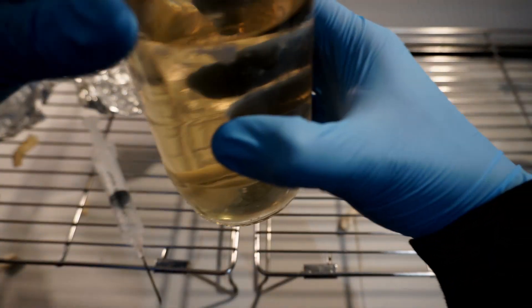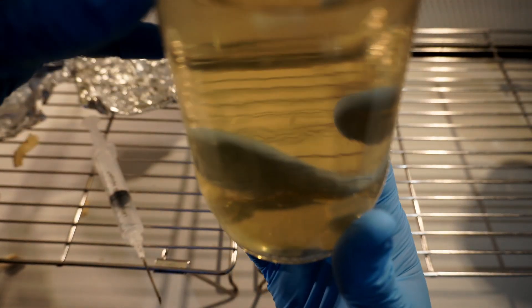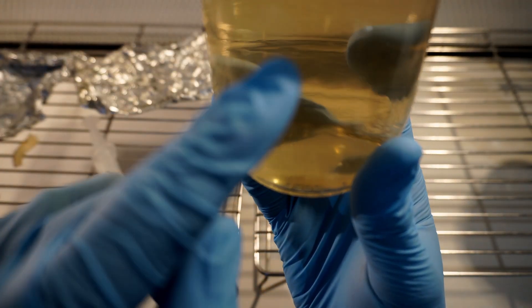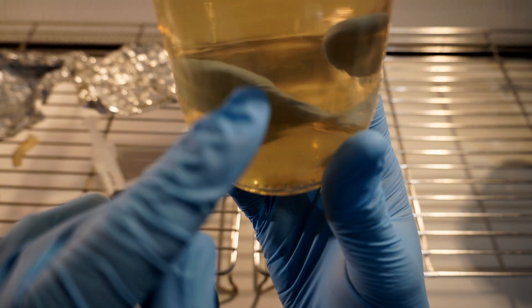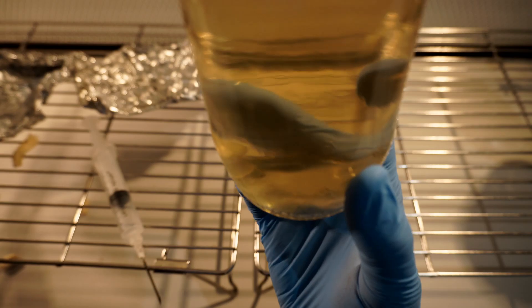There you can see the small little filament is slowly making its way to the bottom of the liquid culture jar. Leave this for about a week, it'll probably get to about a centimeter in diameter. After about two weeks you'll probably have enough liquid culture to actually use.